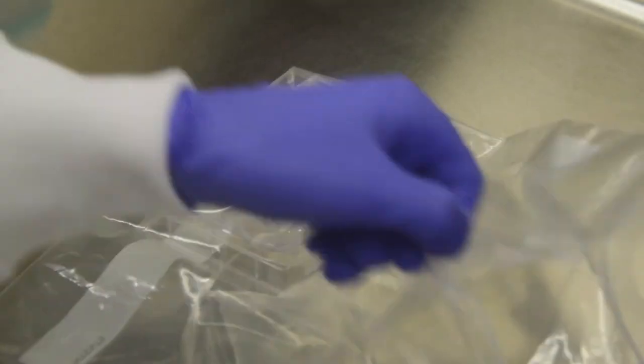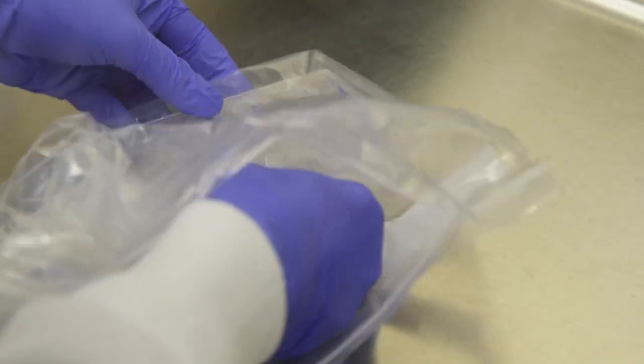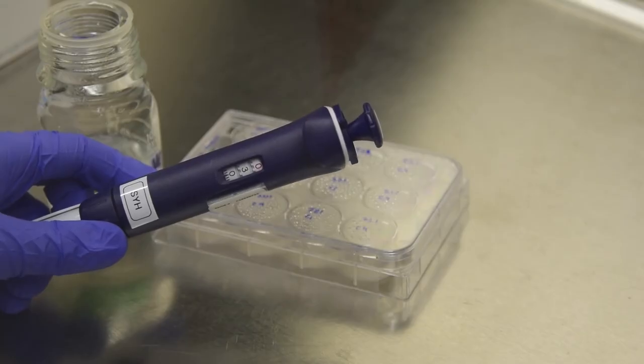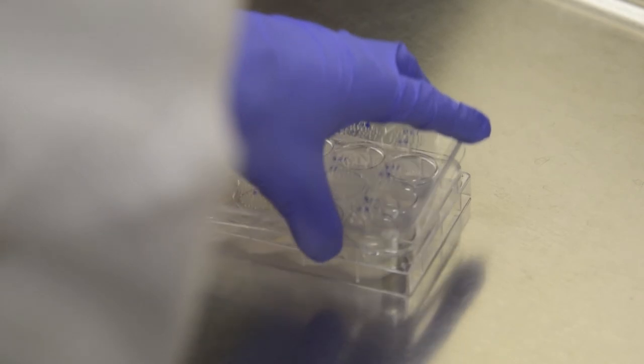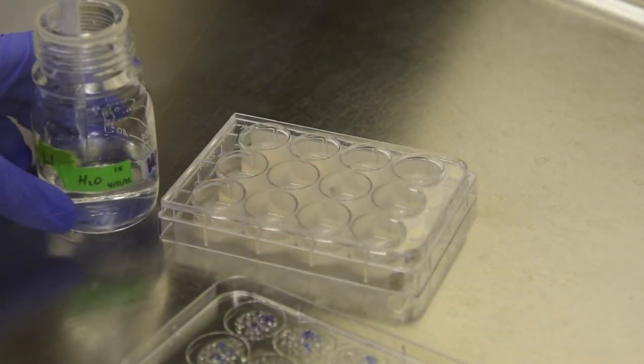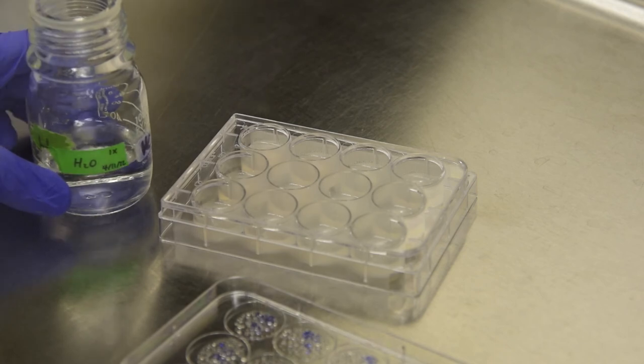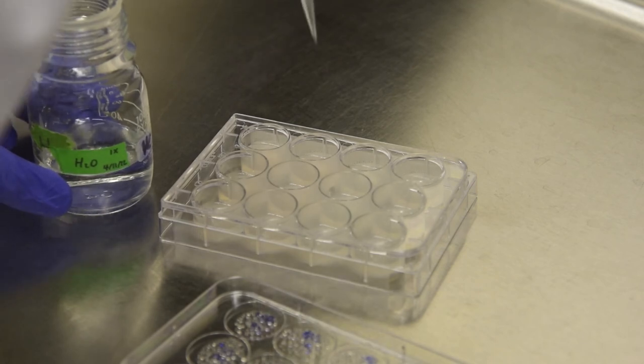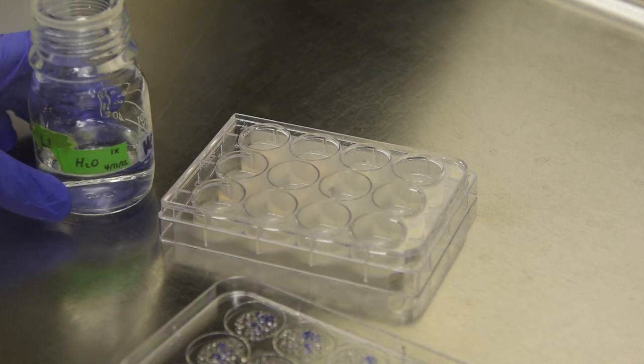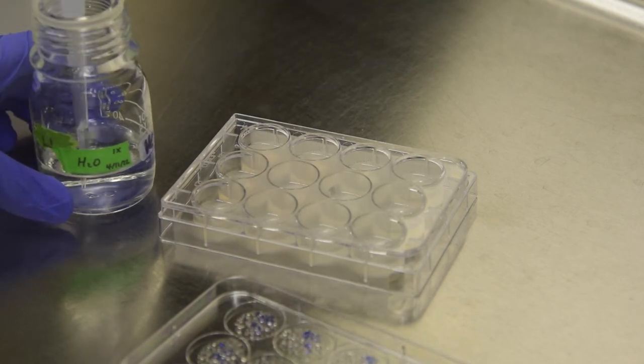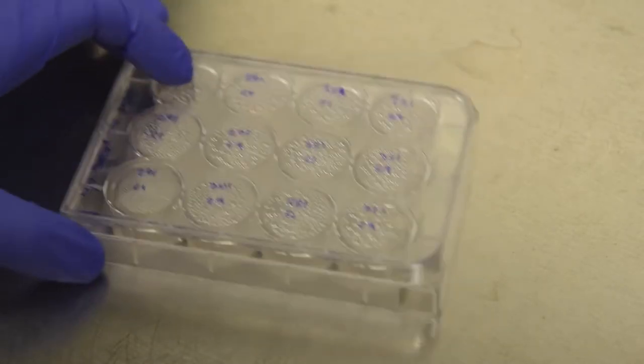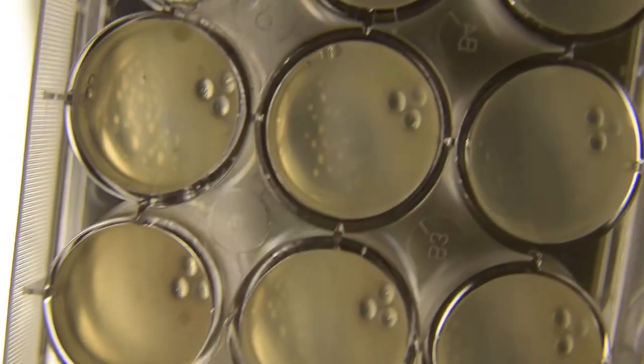After 3 days, remove the plate and add 300 microliters of sterile water to each well. Gently shake the plate to allow the beads to resuspend any adhered growth.